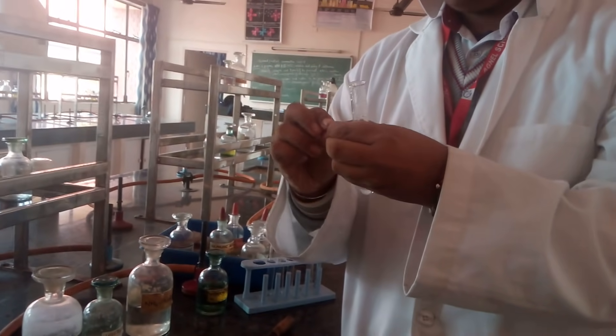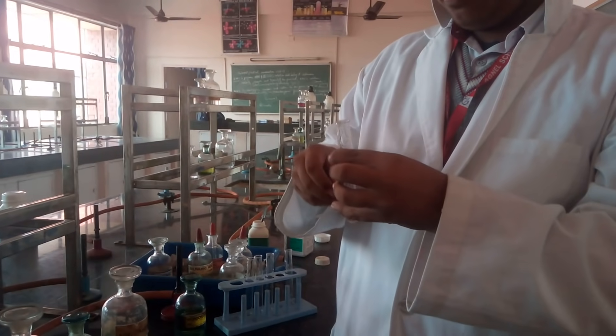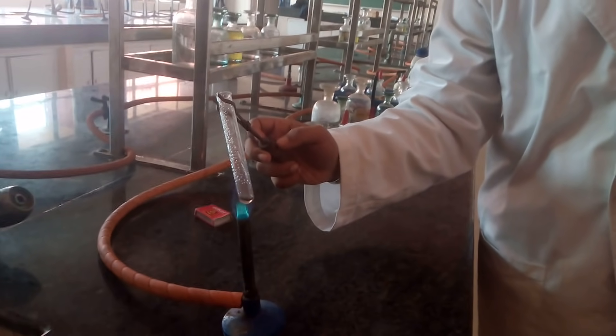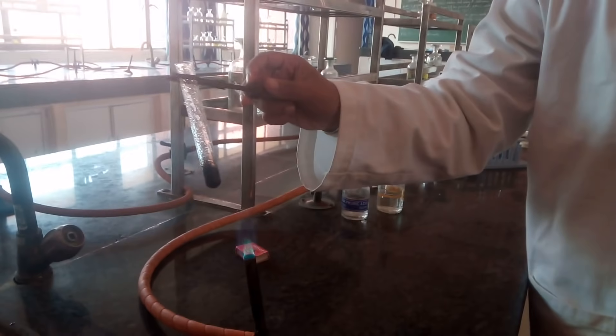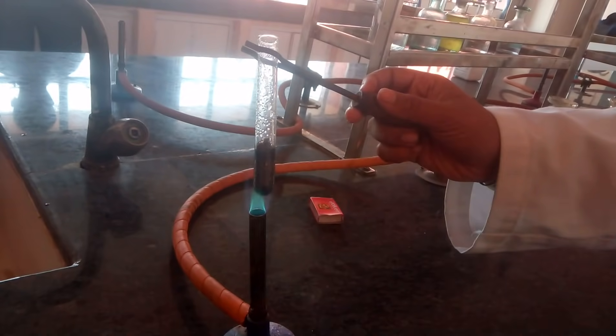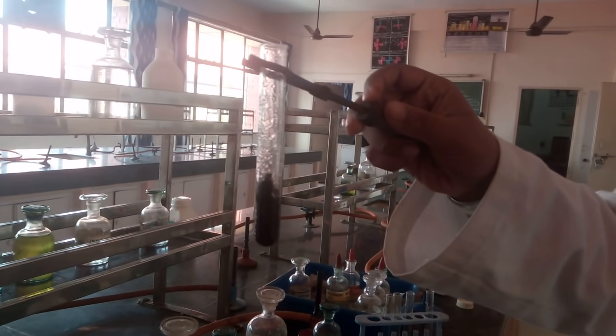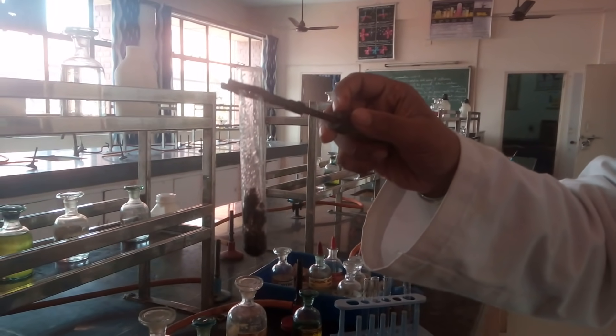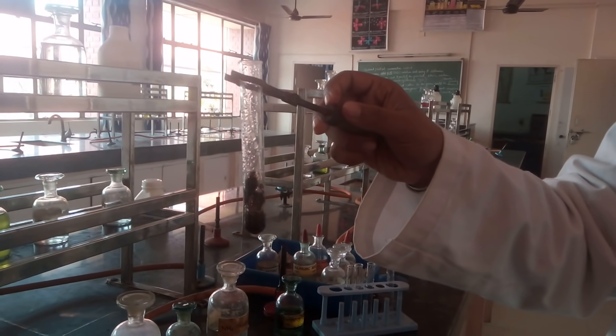This piece of paper is a carbon provider. You need to heat the contents so that the carbon can react with your solution. If there is a nitrate, the carbon will convert the nitrate into NO₂ gas which would be brown. It's turning black but it's not a gas — gas would be on the upper side of the test tube. The solution is turning black but there is no gas at the upper end. This black is due to the carbon which has lost water due to the concentrated sulphuric acid, which is a dehydrating agent that absorbs water from the paper leaving behind carbon.